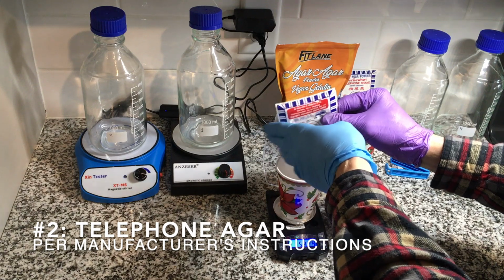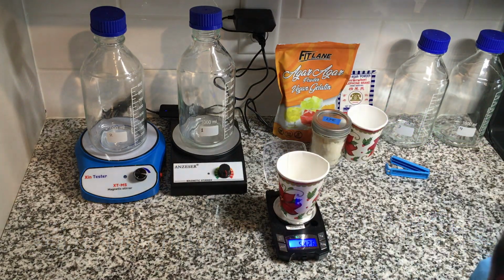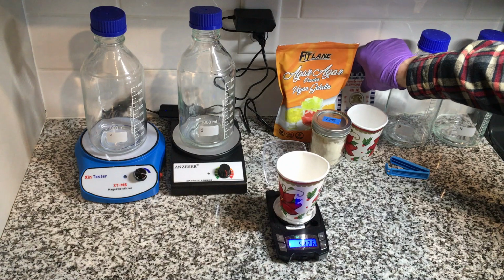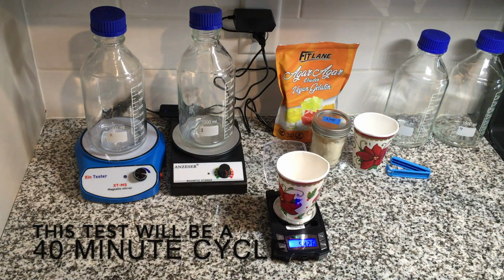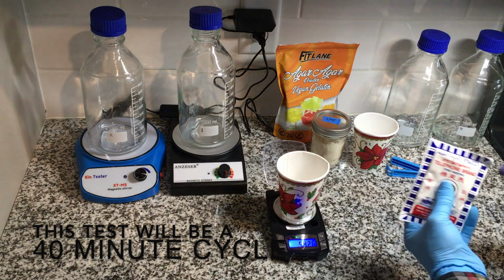And I'd also heard advice about the length of the PC cycle, going from 30 and then to 45 minutes and then up to 60 minutes, with longer being better. So I'd increased my cycle time to 75 minutes.